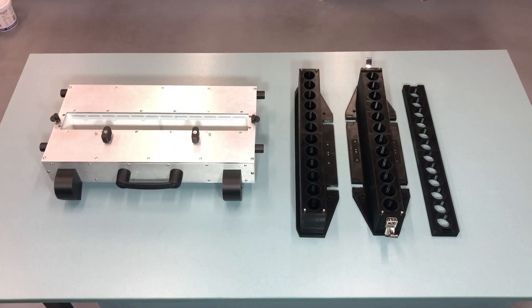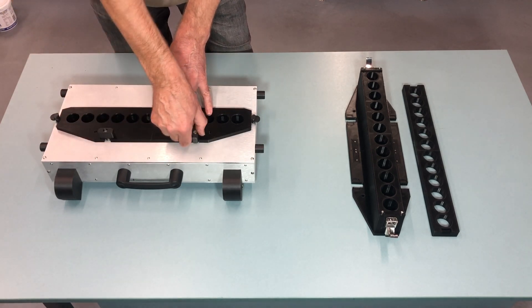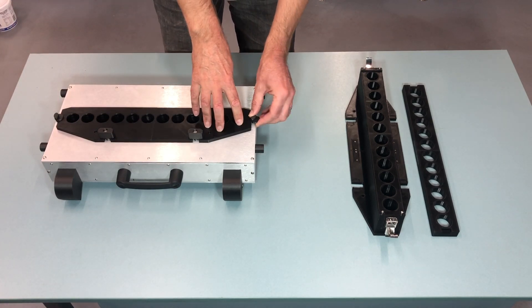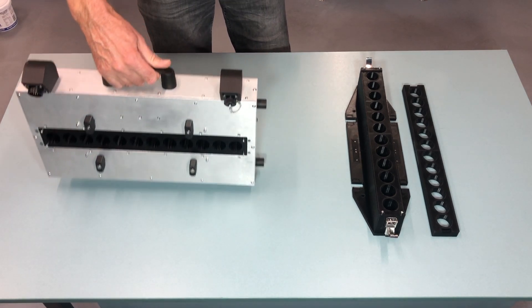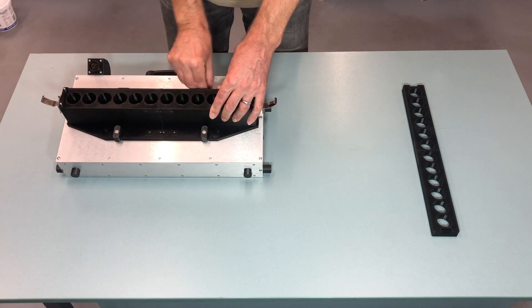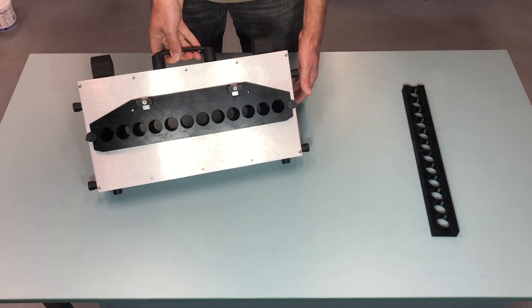The first step is to ensure that the new counting head will physically fit in your machine. So you're going to put this head together. This is just to keep the tablet guide steady — they don't have to be very tight, just a little bit. Then the other one. Like that, similar to the old one. So then you put this one into your machine to see if it fits.